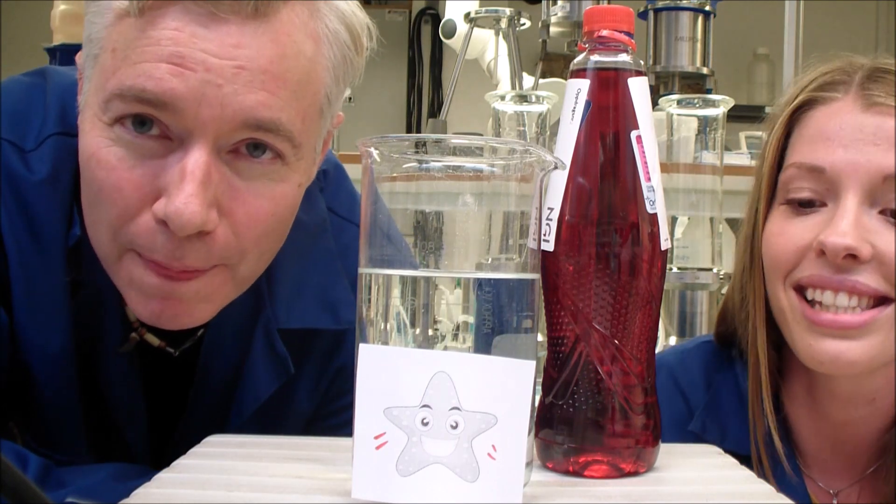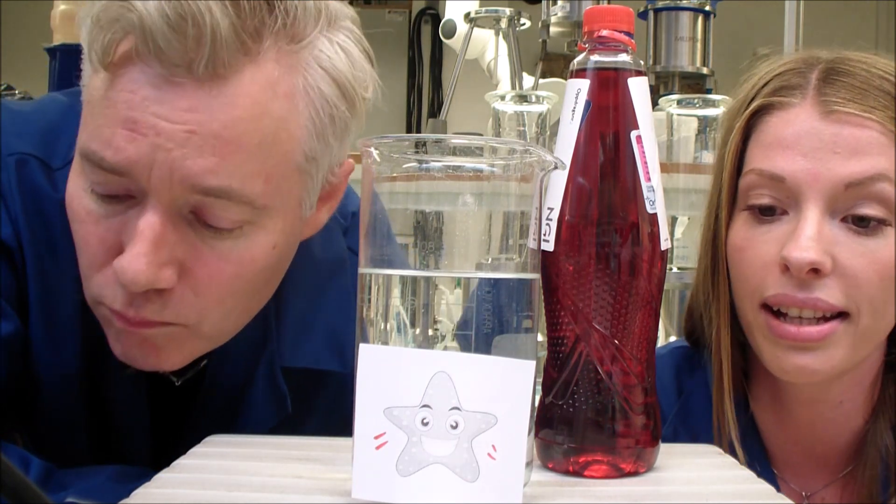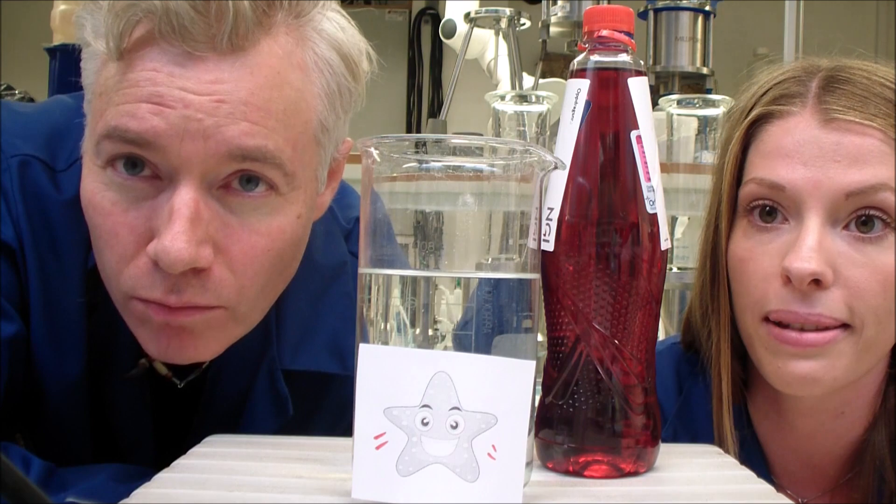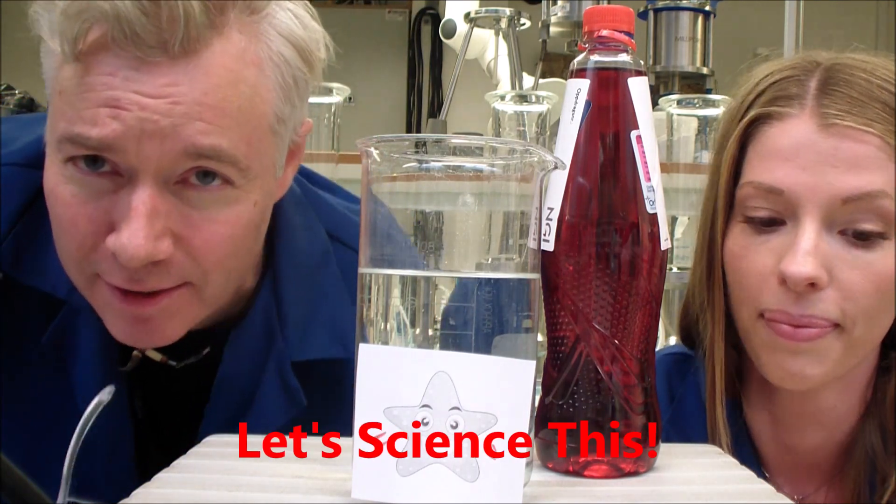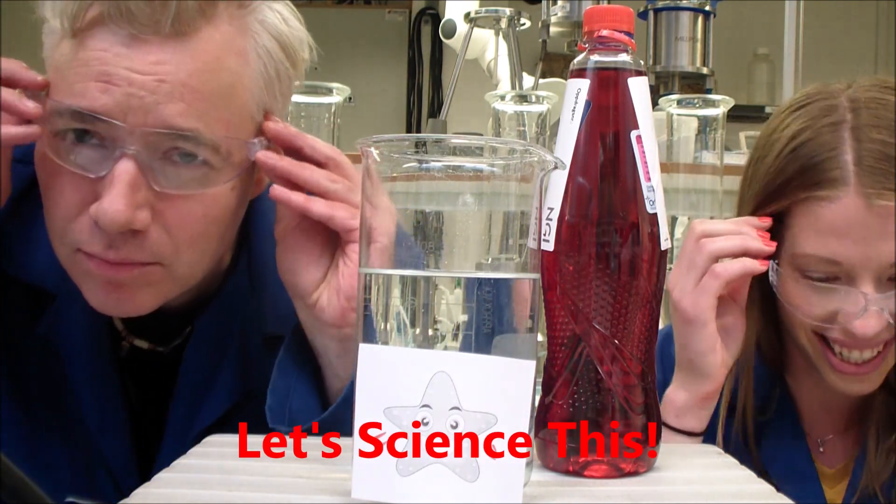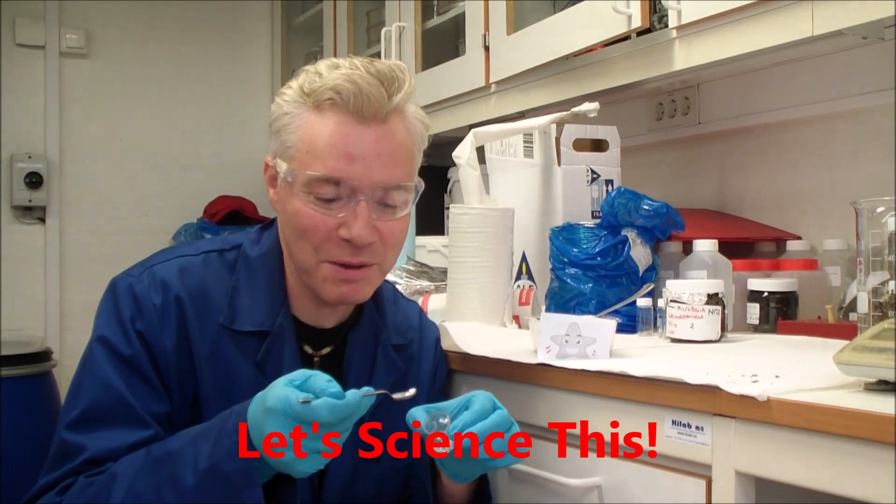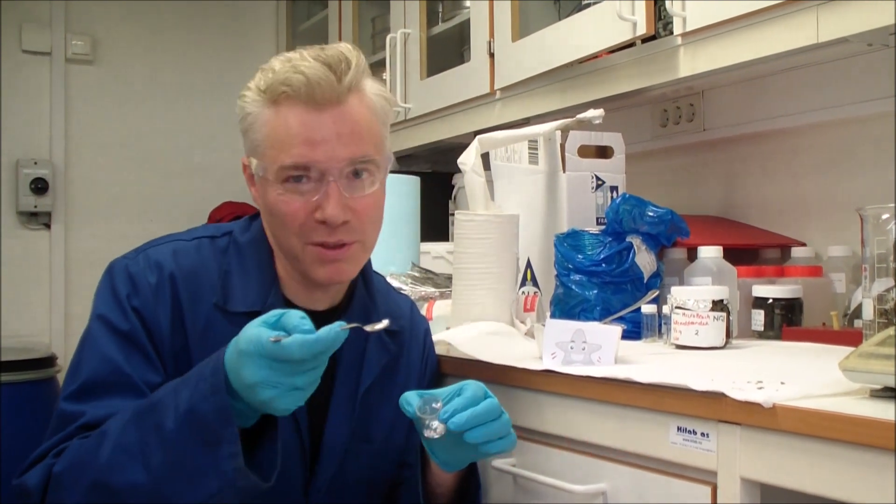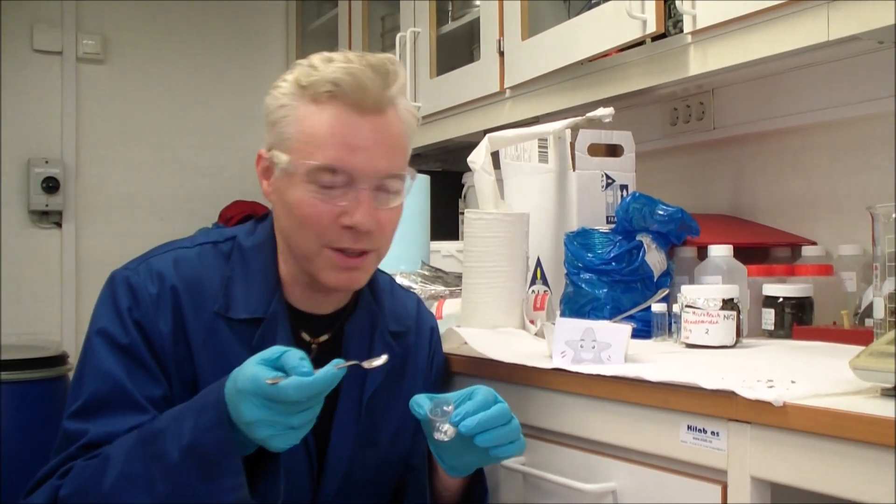So, what we want to show is how we can separate these dense plastics from sediment. Yeah, so let's science this. I have some PET pieces, and we're going to put them in sediment just to show you how this works. So, I'll put some in there.